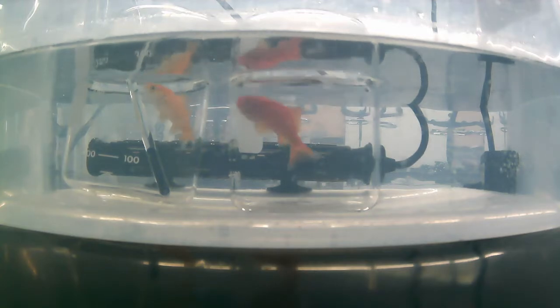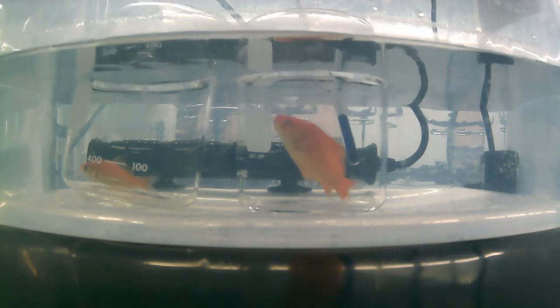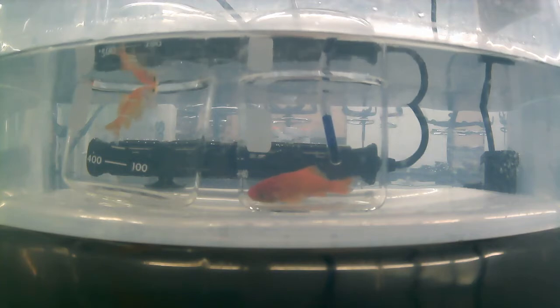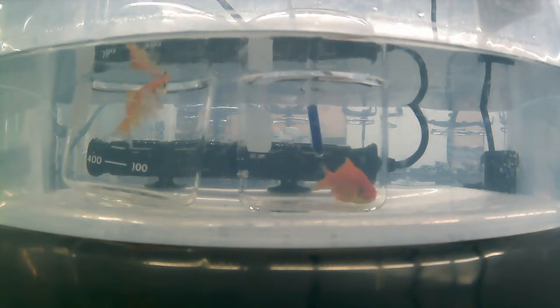And that's a full sideways, so I'm going to go ahead and call him. You're at about 36.9, I'm going to say.